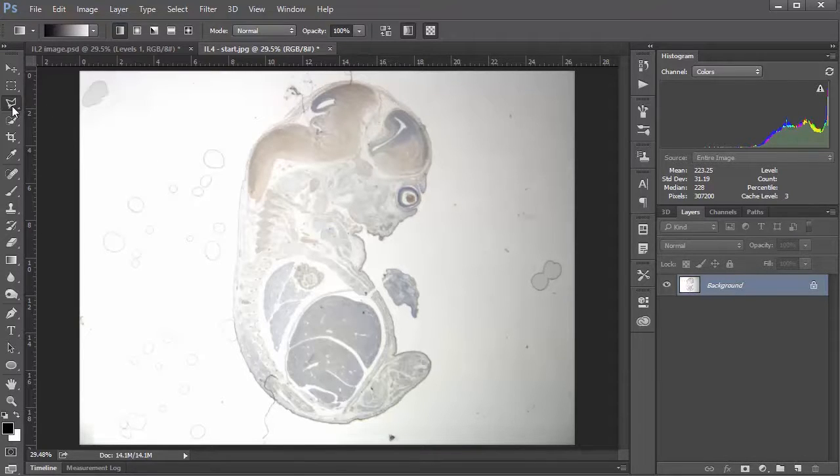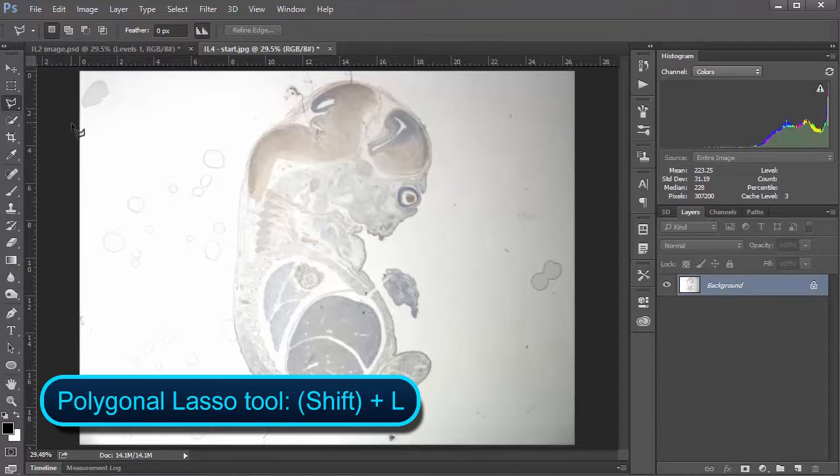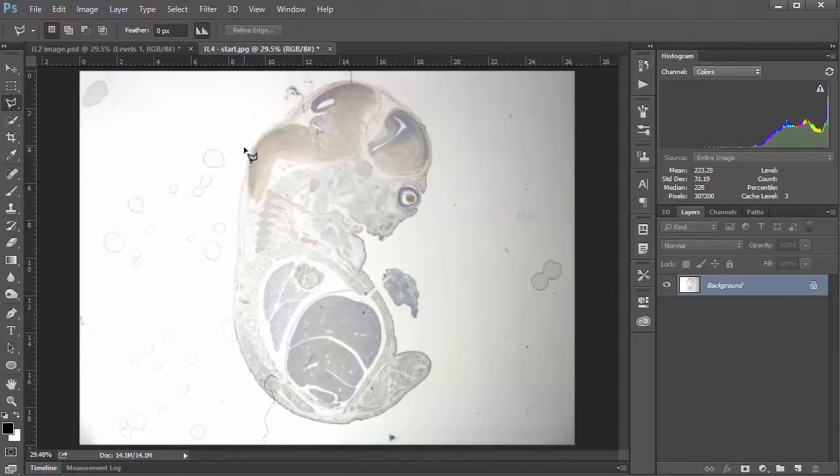So I want to choose the Polygonal Lasso Tool, which if you don't see, you might see the regular Lasso Tool by default. If you click and hold, you'll see this little flyout menu, and you'll choose Polygonal Lasso. For all the fans of shortcut keys out there, you can just hit Shift-L a couple times to toggle through them all. Then what we want to do here is create a pretty close selection around our little section. We don't need to go crazy along the edge, but the closer we can get, the better.